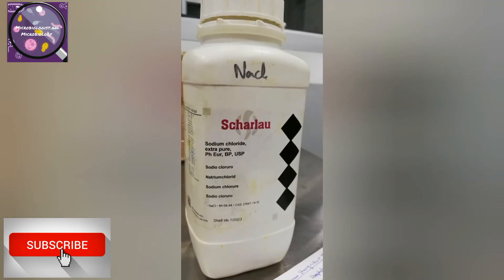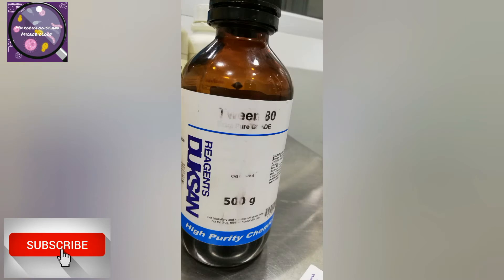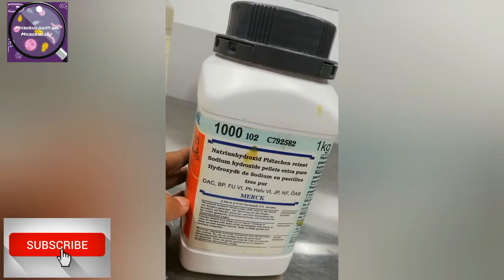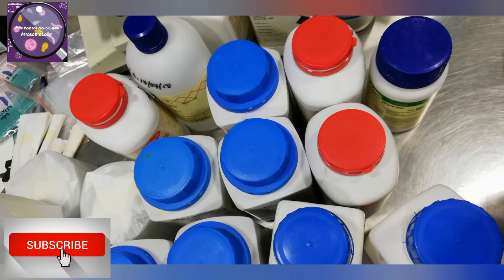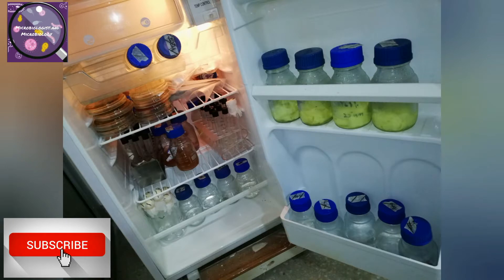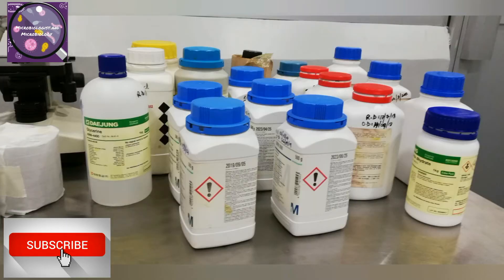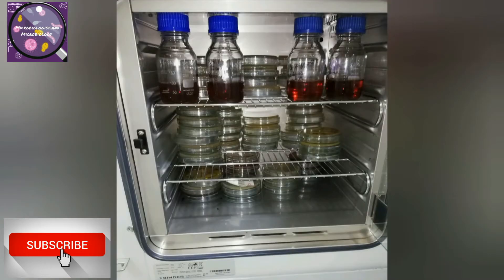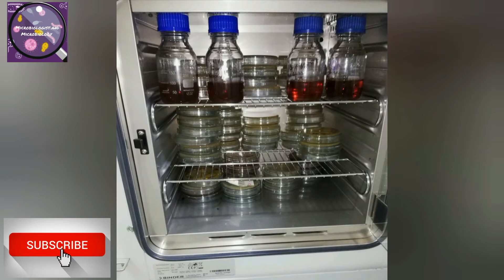We store these chemicals at room temperature, that is 25 to 30 degrees Celsius. After preparation we have two to three options: store liquid media in a refrigerator and re-melt through a water bath whenever required, or pour the media into petri plates and pre-incubate at recommended temperatures before doing the test.